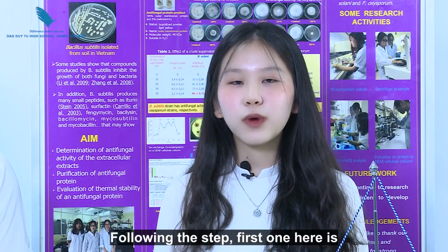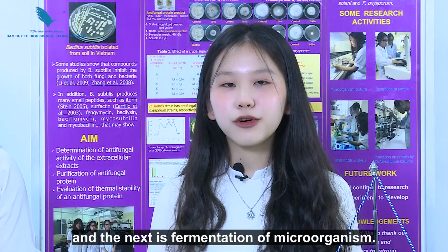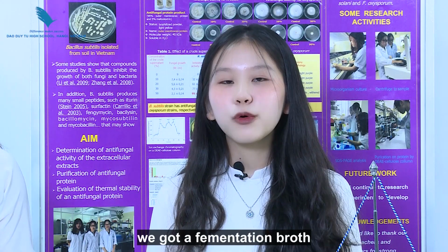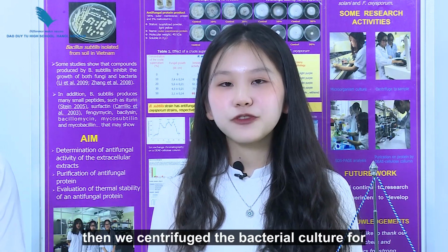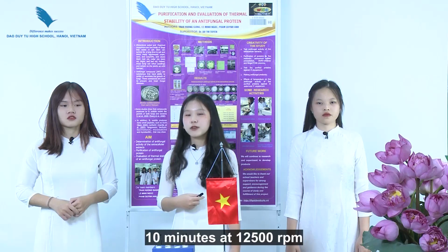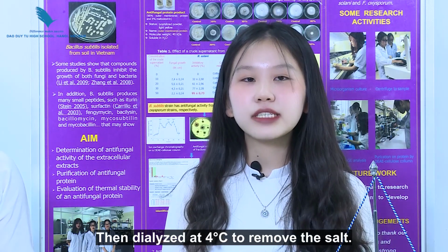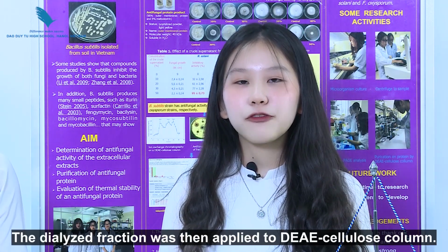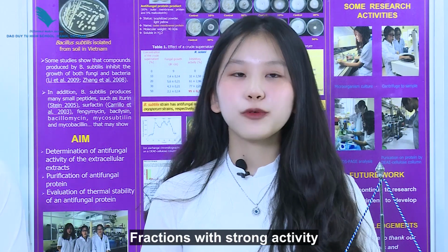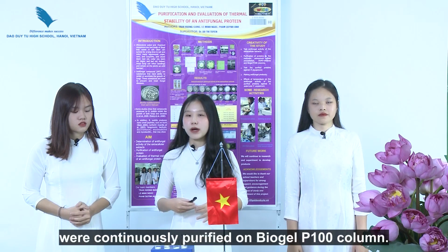Following the steps, the first one here is determining the crude supernatant, and the next is fermentation of the microorganism. After it was incubated at 30 degrees for 5 days, we got a fermentation broth. Then we centrifuged the bacterial culture for 10 minutes at 12,500 revolutions per minute to collect crude supernatants. Then we dialyzed at 4 degrees to remove the salt. The fractions were then applied to a DEAE cellulose column. Fractions with strong activity were continuously purified on a BioGel P100 column.